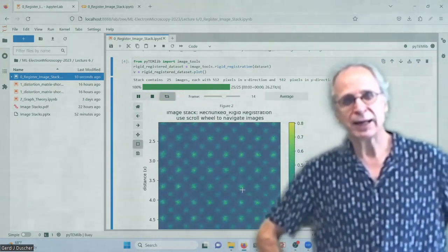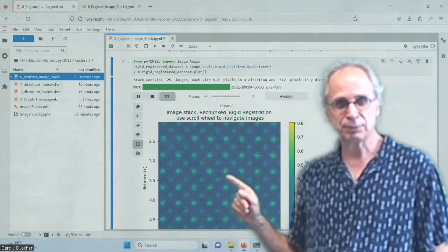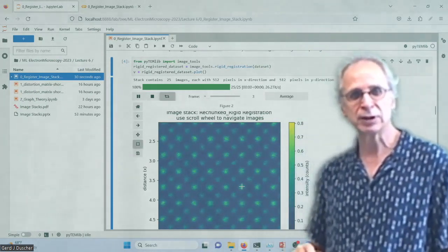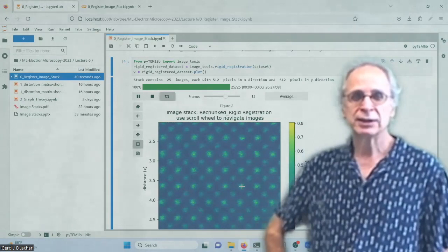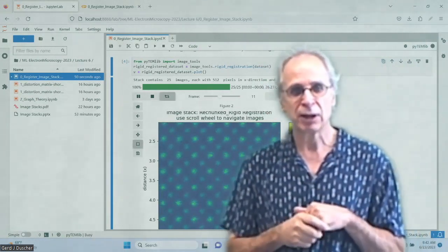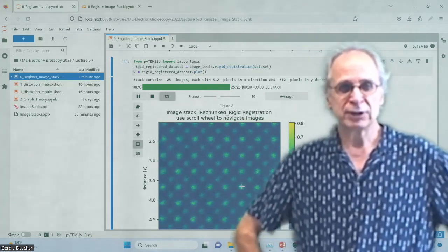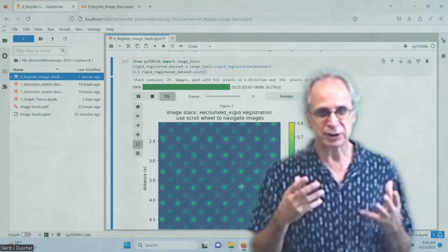And let's talk about why it doesn't make any sense to go to subpixel accuracy here. As you can see, even though the whole frame is extremely stable, the atoms dance around a little bit. If we have a spot here, you can see they jump around by a pixel or even more. So this is not something that would benefit the accuracy if we do it better than 1 pixel, because then we would have to interpolate that. And so we want to avoid interpolation as long as possible. So what we are going to do is leave that there. And this random positioning here are, of course, instabilities in your scan.